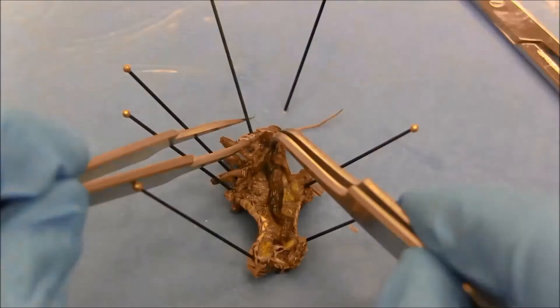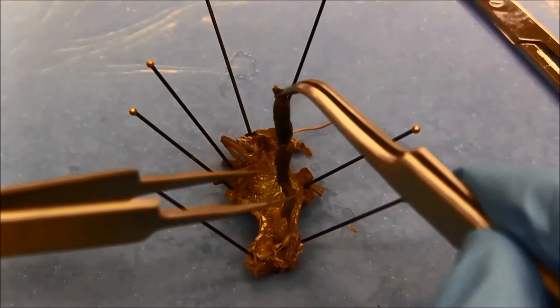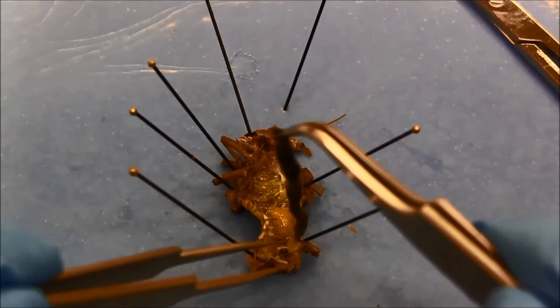I have a male grasshopper here. If you dissect a female you might want to remove all the ovaries and fat bodies before you pull out the gut.